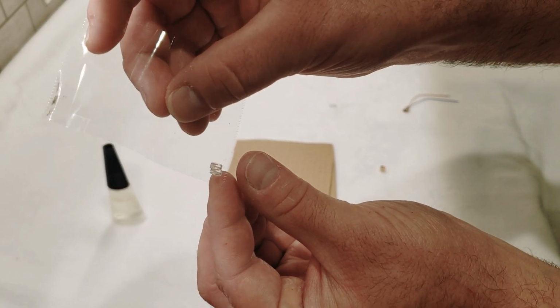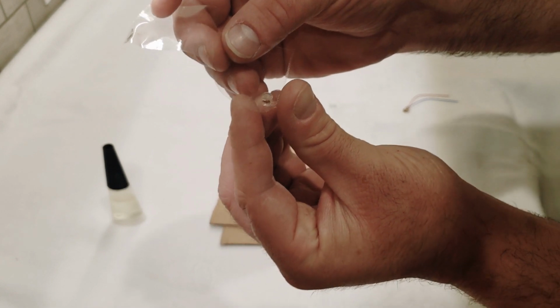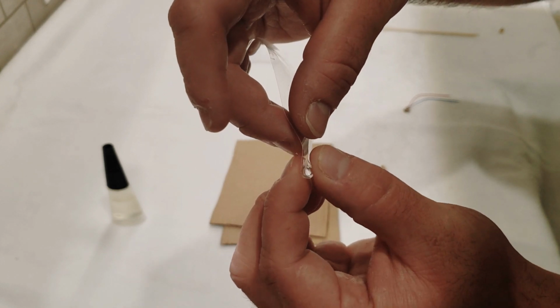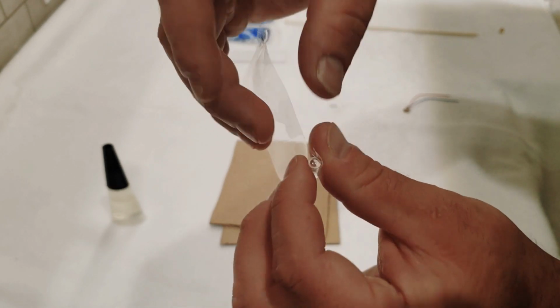They're pretty close lined up there. And when we roll them up, it's going to line them up a little bit better. So now we're going to take this and just start rolling it up. Oh, come on. Let's go in there for a second.